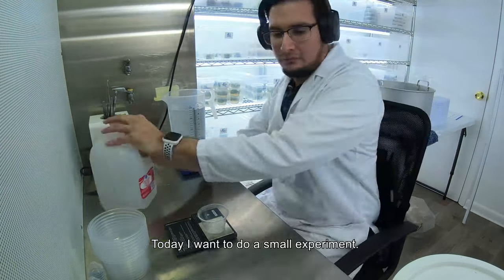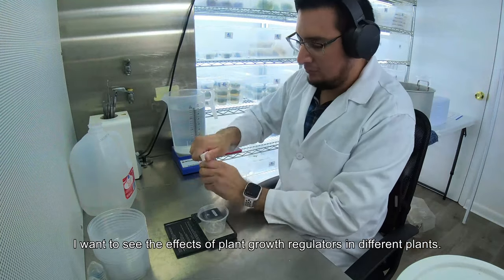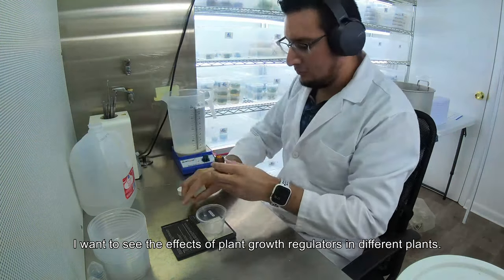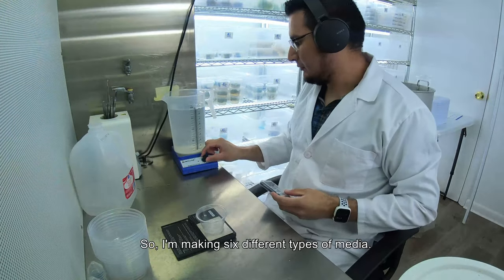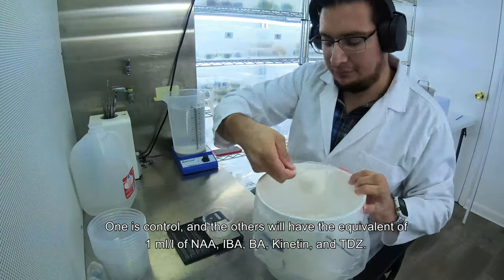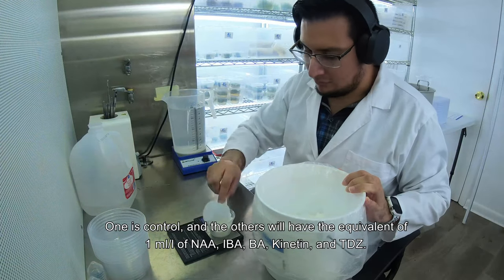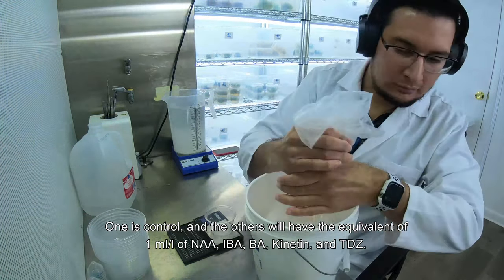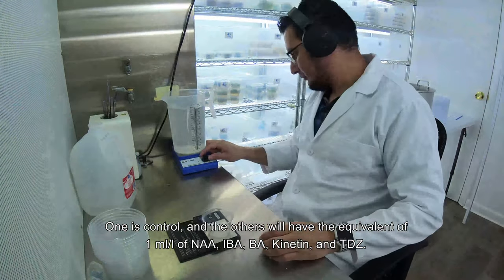Today I want to do a small experiment to see the effects of plant growth regulators in different plants. I'm making six different types of media: one control, and the others will each have one milliliter per liter of NAA, IBA, BA, kinetin, and TDZ.